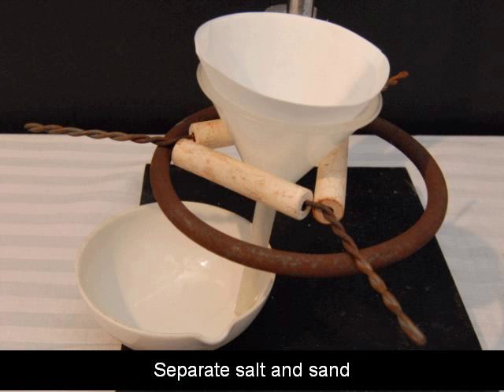Notice right here I have the end of the funnel touching the edge of the evaporating dish. And that's going to be important once water starts pouring through here. Water is sticky. It likes to stick to different substances. It's attracted to ceramic or clay-like material like the evaporating dish is made out of. And once it starts filtering through, it will contact that clay and it basically helps pull it through the filter when that water droplet is connected between the funnel and the evaporating dish.